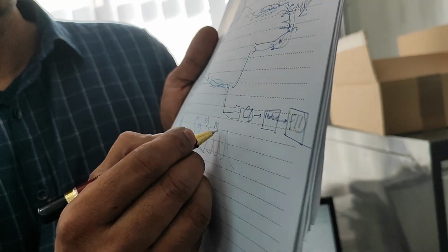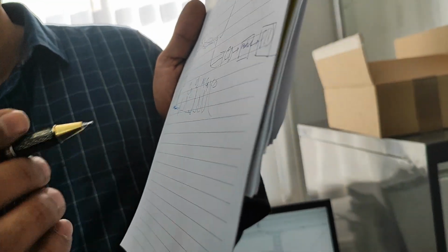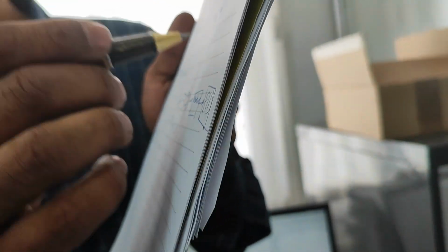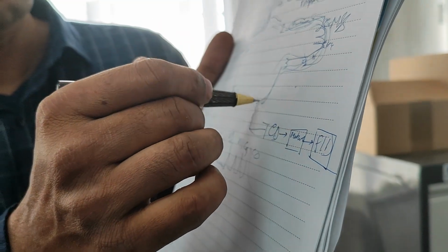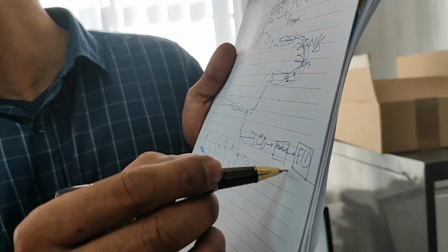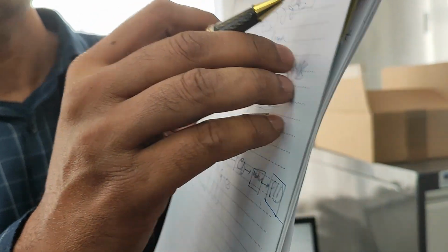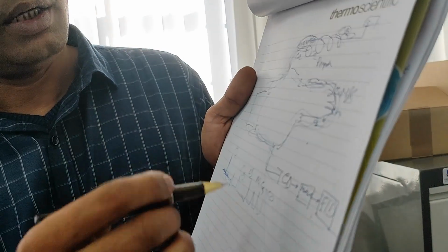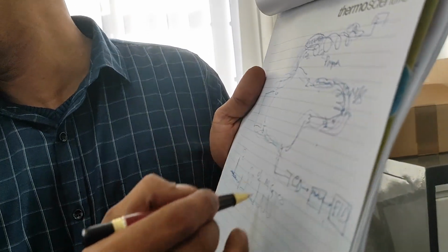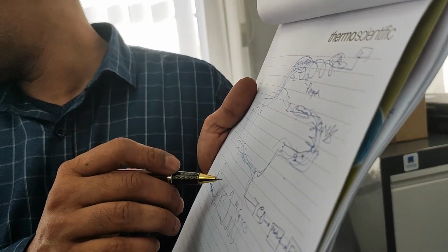O2, N2, CH4, CO. If this column length is shorter, then we can take the hydrogen first, and oxygen to CO can be trapped here. Then CO2 can be eluted from here. After CO2 elution, these 4 can be released. Okay. This is model 2.